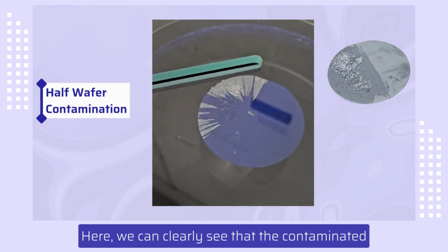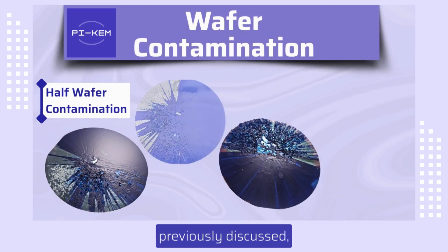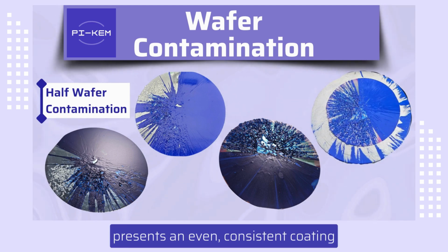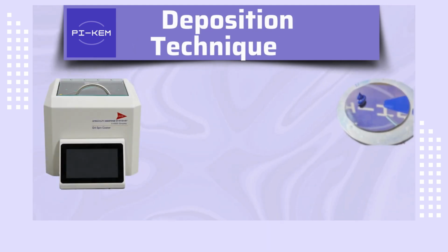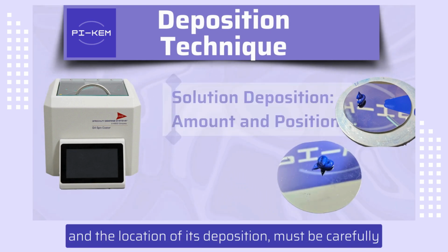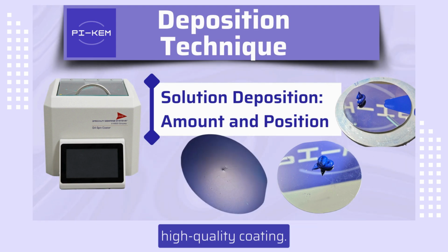Here, we can clearly see that the contaminated half of the wafer presents several of the surface defects previously discussed, whereas the clean half of the wafer presents an even and consistent coating across the surface. The quantity of coating solution and the location of its deposition must be carefully controlled in order to achieve a successful, high-quality coating.